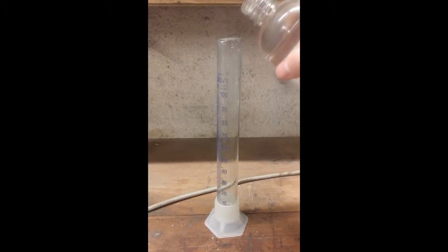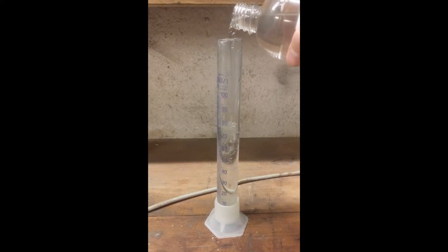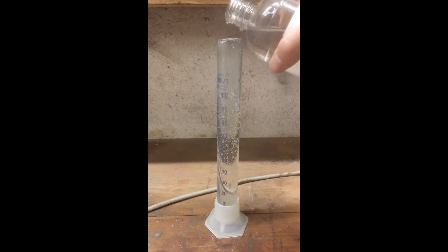So let's start with 100 mLs of our sodium silicate solution. The MSDS says that it's 35 to 43% sodium silicate by weight. Doing molar calculations isn't worth it here. We used the double stoichiometric quantity of HCl and we still had to add more, we'll explain later why.